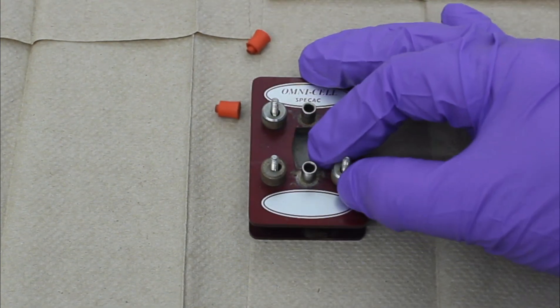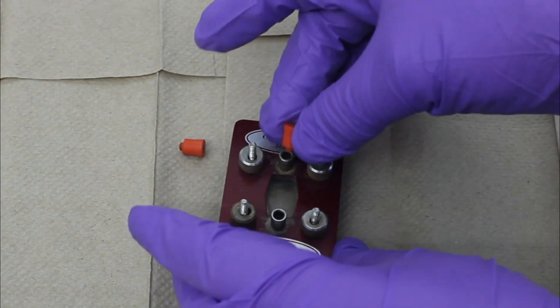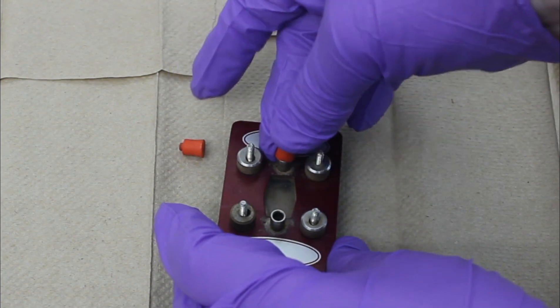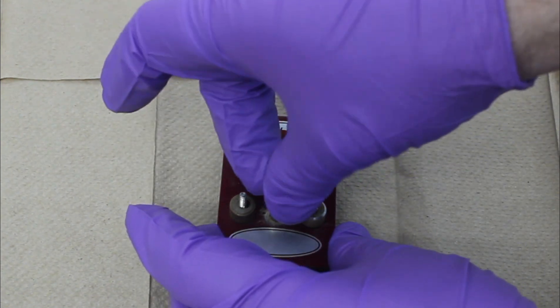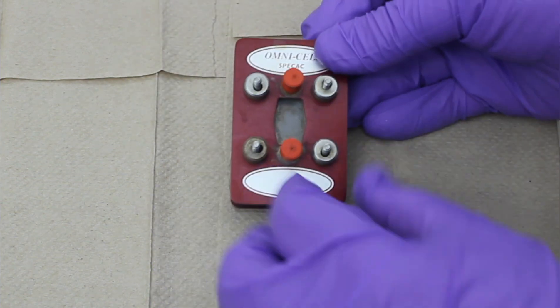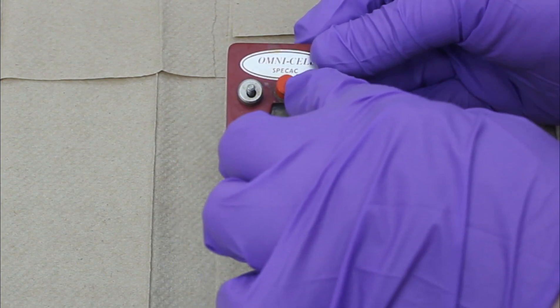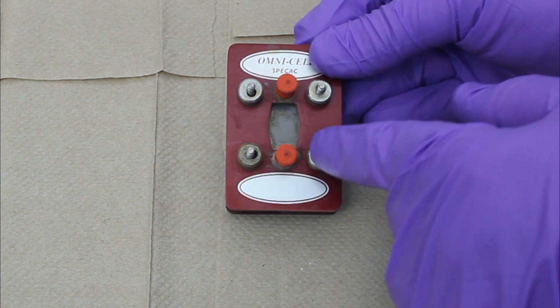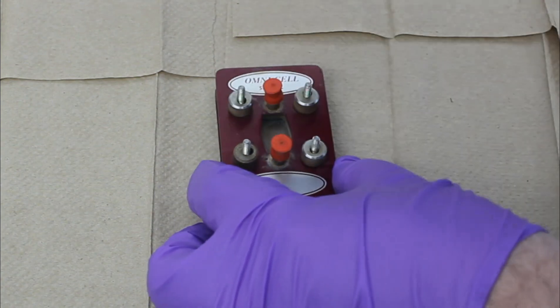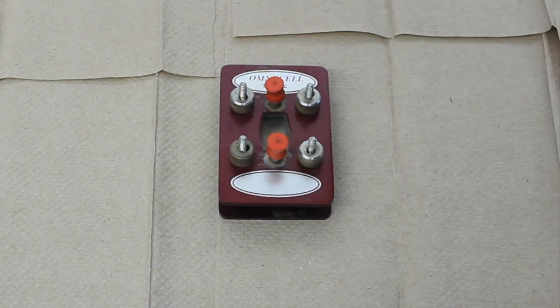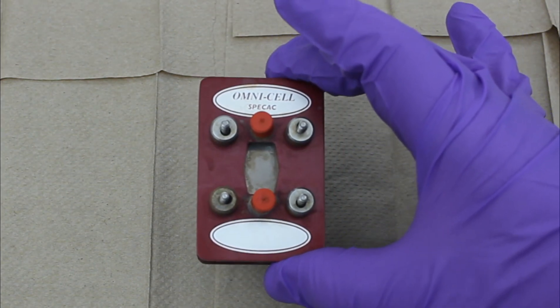And if it's something as simple as you have a small chunk of sub-a-seal stuck in here, what you would do is place this here, place this here. You would inject your sample from the bottom. You would have a vent needle on top. And then your sample would flow and come out a little bit out of that vent needle. And then you take your cannula and your vent needle out. And now you're ready to collect data through your infrared cell.